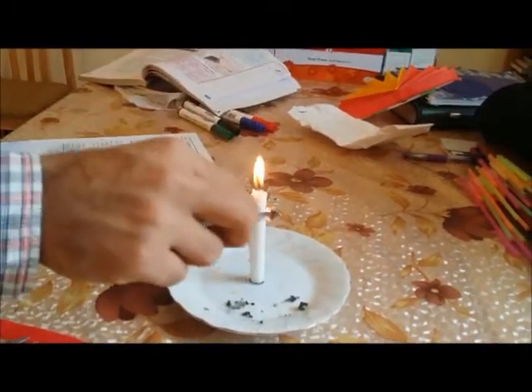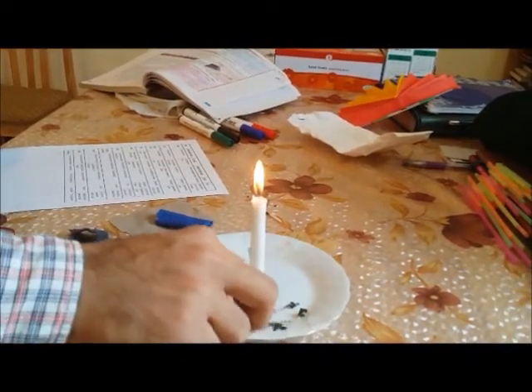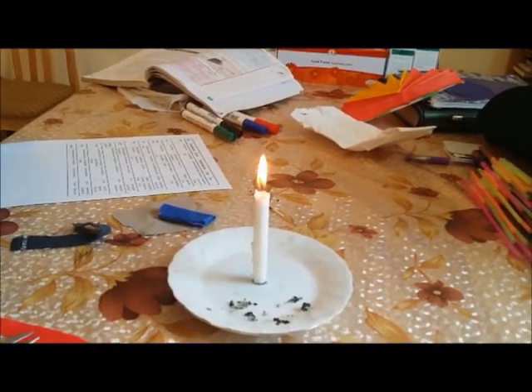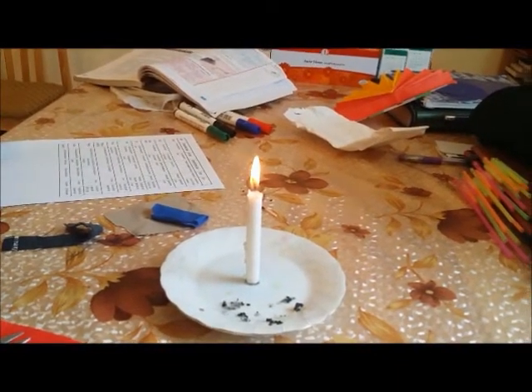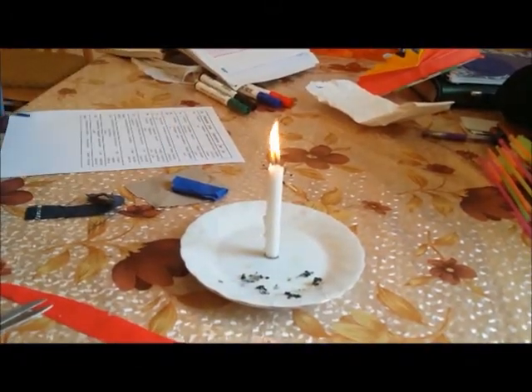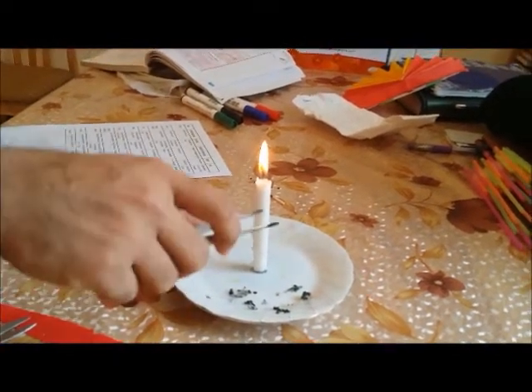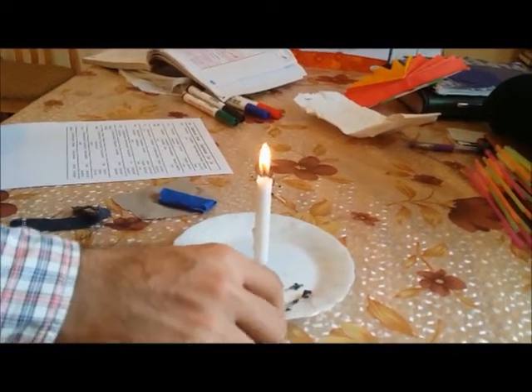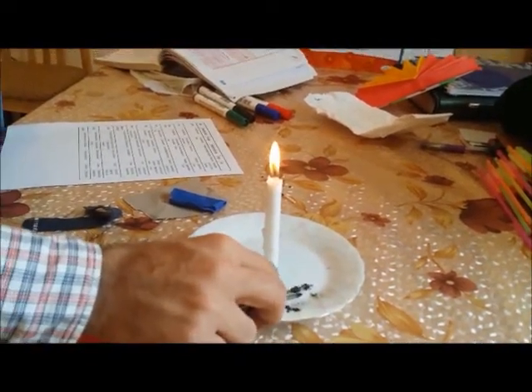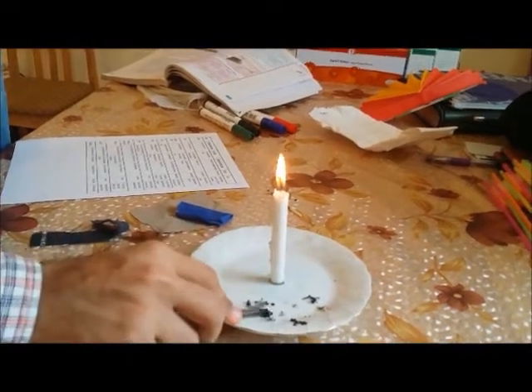When removed from the fire, it stops burning. Then the smell that comes is just like a burning hair — and a more strong odor, stronger than silk, a sort of odor which is much stronger than silk. Giving a flickering burn, curling away. And the final residue is a crisp — dark. You can see it's crispy, it can turn into powder.